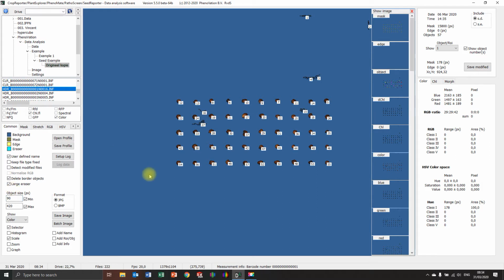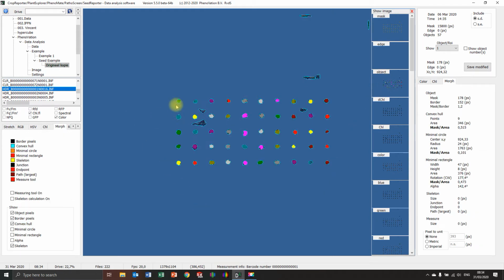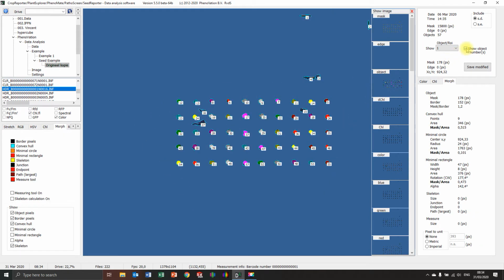Okay, now most of the noise is already gone. And I unchecked this. You see, we still have some noise, but I'm not going to analyze the objects. You can analyze with objects, then it will do the numbers.